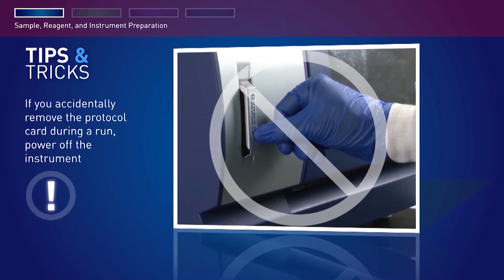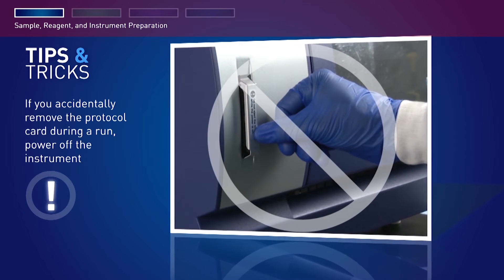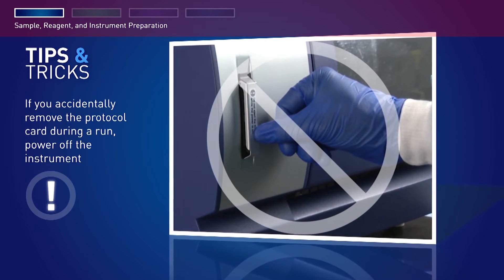If you accidentally remove the protocol card during a run, power off the instrument immediately to minimize potential for instrument data file loss.